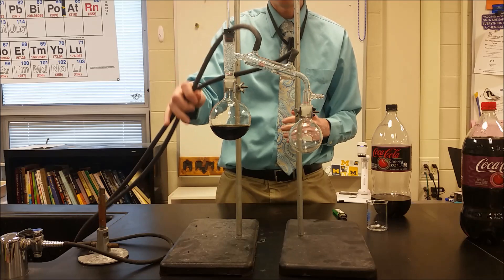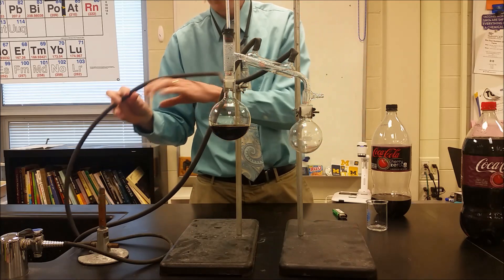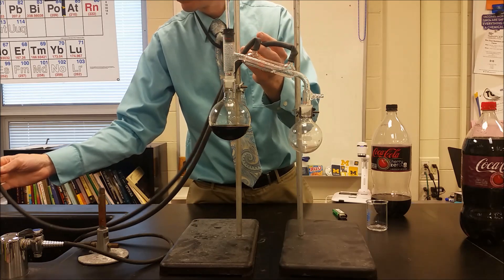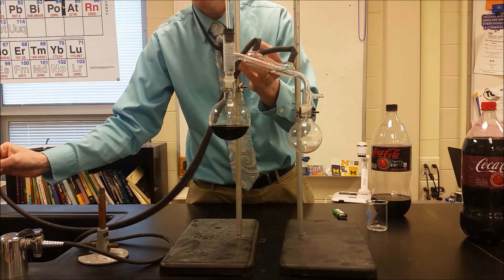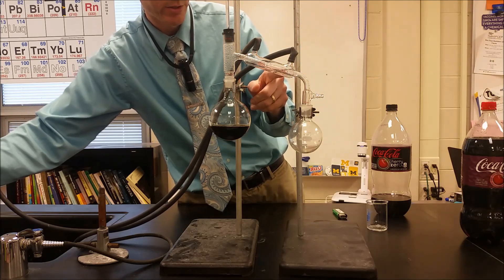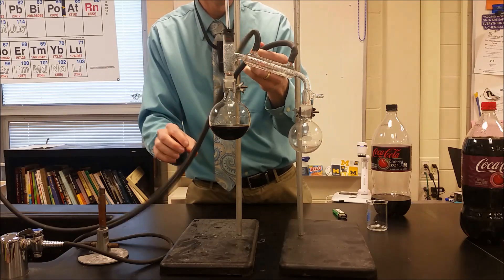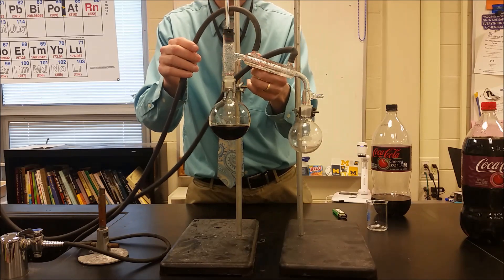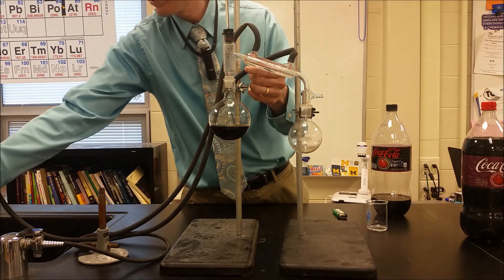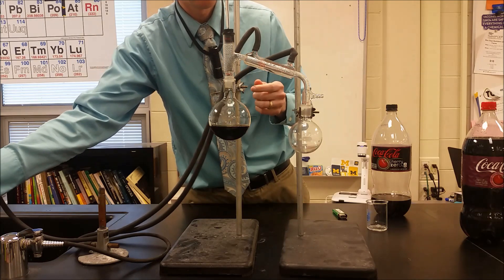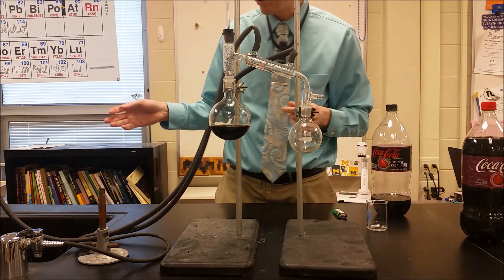And then we're going to have these tubes come in through here, so this one on this side is going to hook up to the faucet like this. And then I'm going to turn the water on, just nice and gently. There we go.